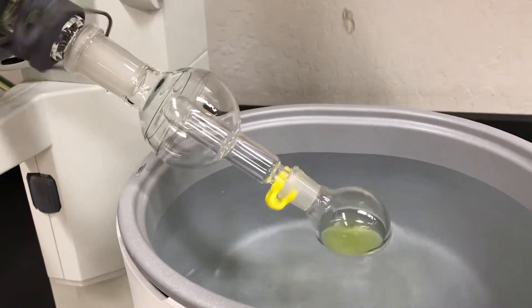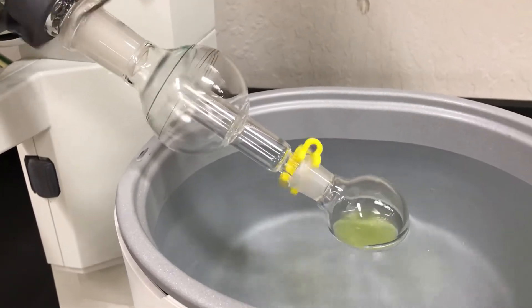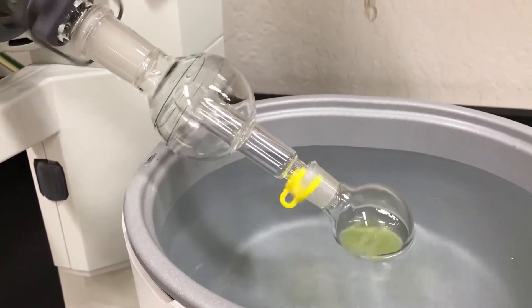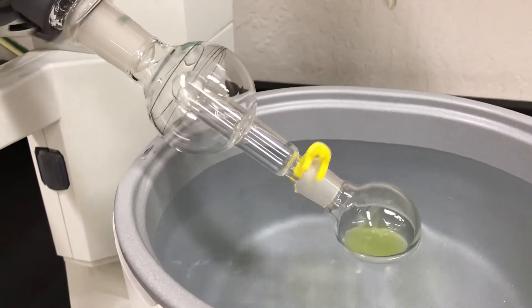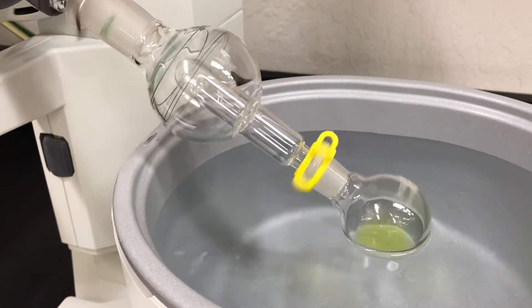So I'm going to speed up the time here but you basically just wait until it looks like the solvent level has reduced a lot. It's also really helpful to know whether you're expecting to get a solid or a liquid. If you think you're going to get a solid you can just wait until solid starts forming.